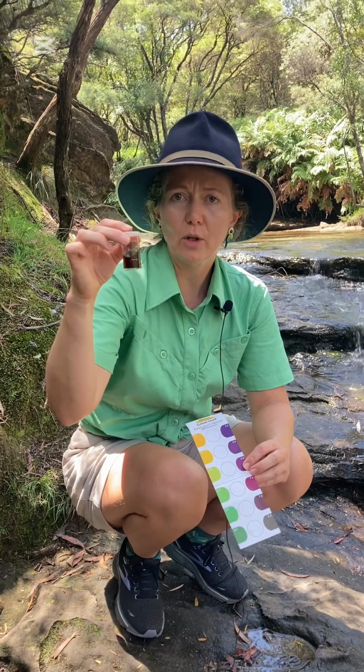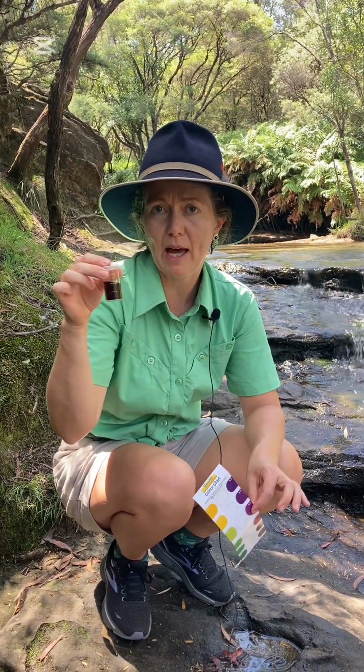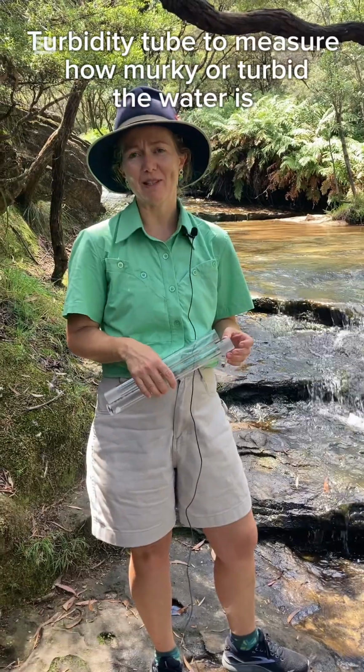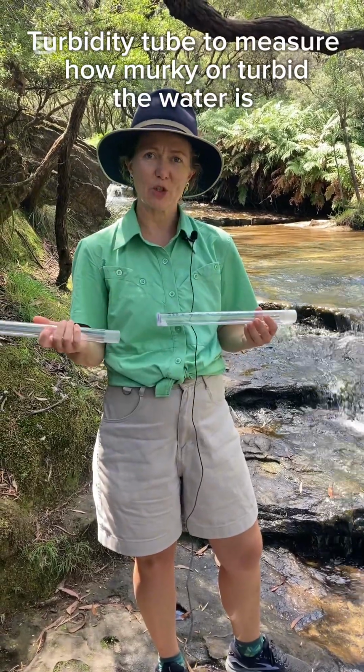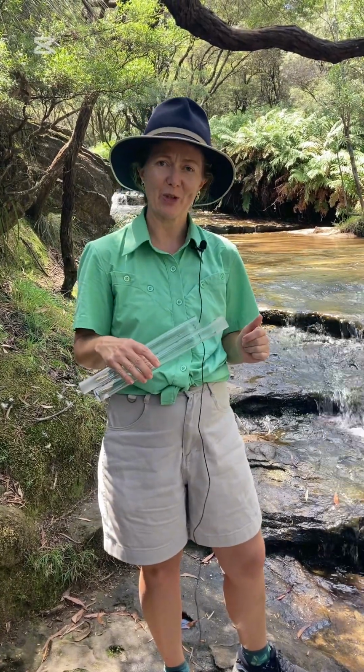Now, I'm not going to tip this out on the side or back in the creek. I'm going to dispose of that into a bottle and take it home with me. I'm going to demonstrate how to use a turbidity tube to measure the turbidity in this beautiful freshwater creek.